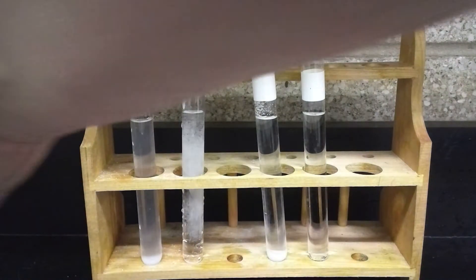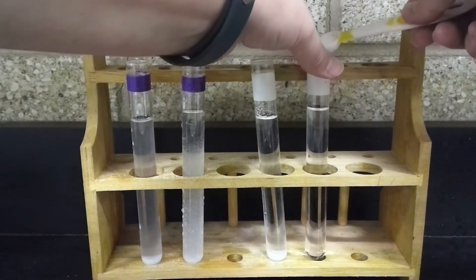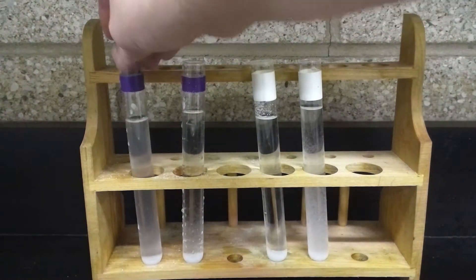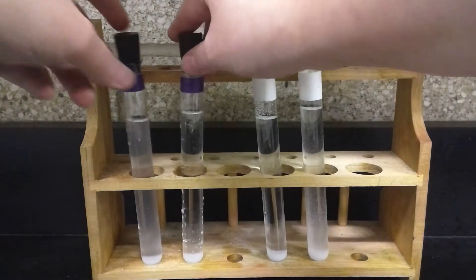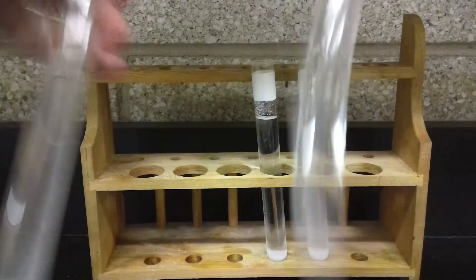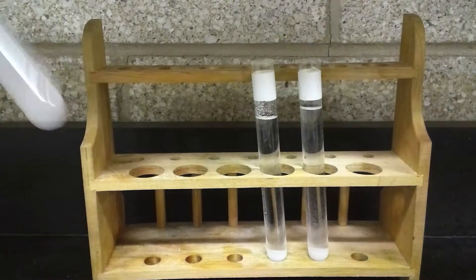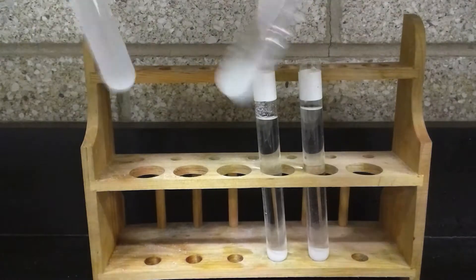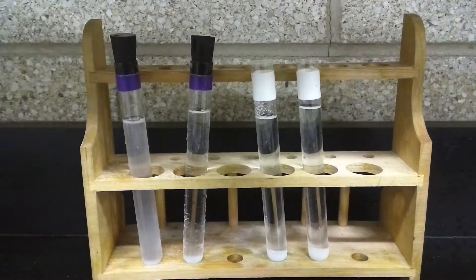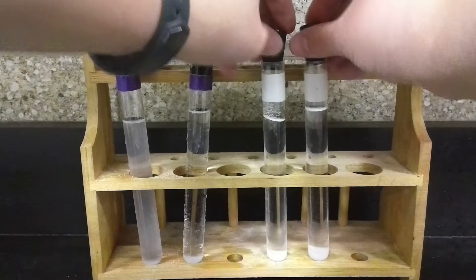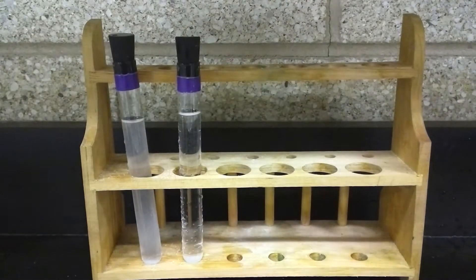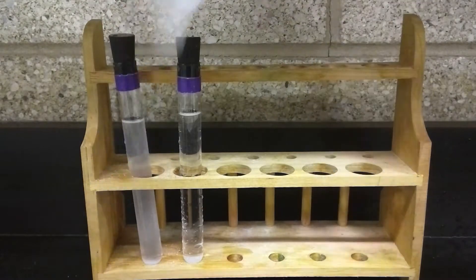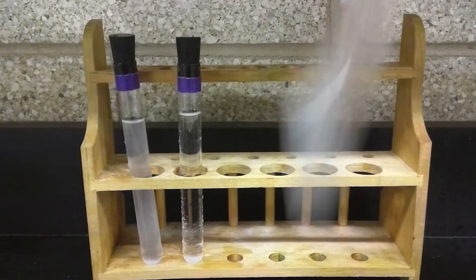Okay, I'm going to go ahead and shake them up. I will start with the water, got the stoppers on, and I'm going to just shake it up. Down for a second. Stoppers on these ones, do the same thing, shake them up. All right, so getting a good shake.